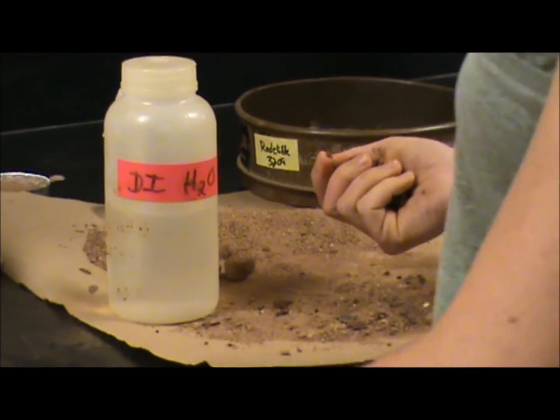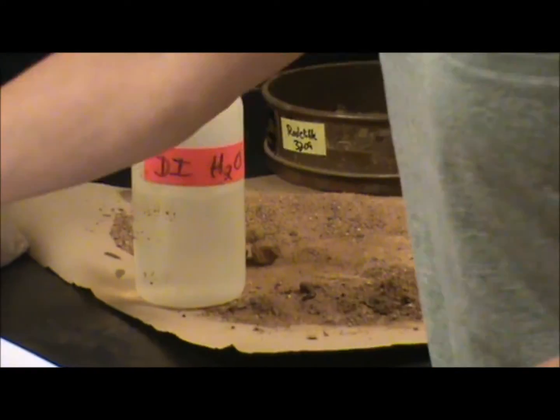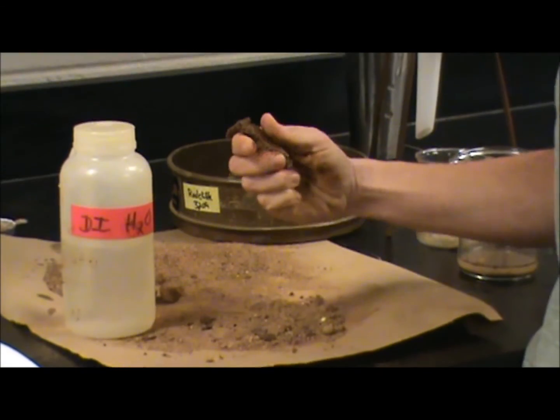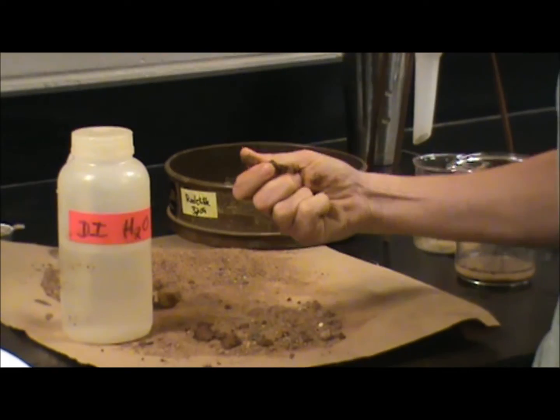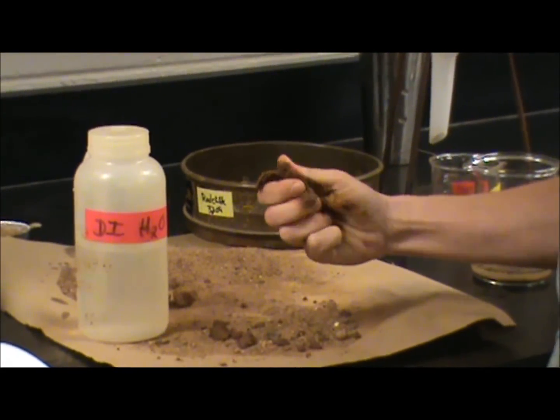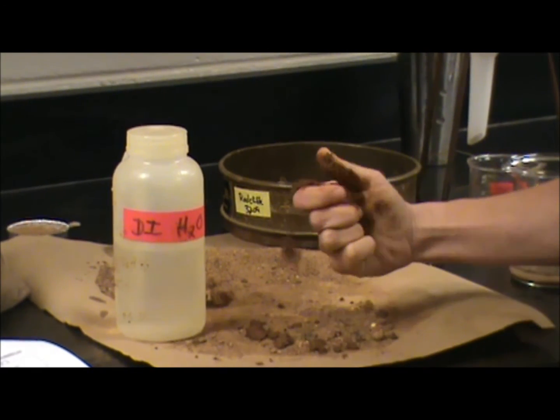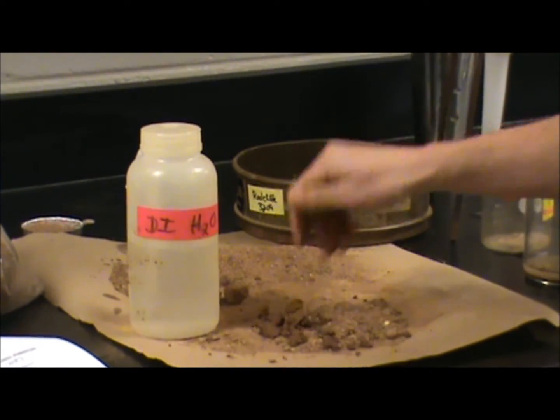And what we're looking to see is if it creates a substantial ribbon. If a sample has a lot of clay in it, it'll stick together, and then you'll be able to form a large ribbon. But as you can see, this sample does not have a lot of clay. It's very, very gritty, so you can feel the sand in there, and it's not sticking together. If this had clay in it, you would see a ribbon come out, and it would stay together for about 2 inches. But here, we're barely able to get any type of cohesive ribbon.